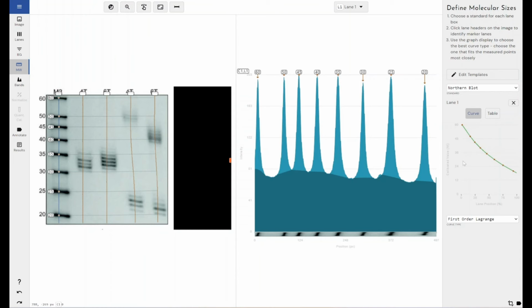So the next step, and you can change the curve fitting for your molecular weight ladder if you know what it is. If you don't know what it is, if it's not been provided by the manufacturer, the best course of action is to pick the value that has the R squared value closest to 1. What that means is the curve fits the data. The closer to 1 the R squared value, the closer the curve that's been mathematically generated fits the actual data that exists there. So I'm happy with that. It's a really nice curve, and the R squared value is extremely close to 1, so I'm very confident that the mathematically calculated values between my molecular weight ladder markers, my nucleotide markers, sorry, is accurate.